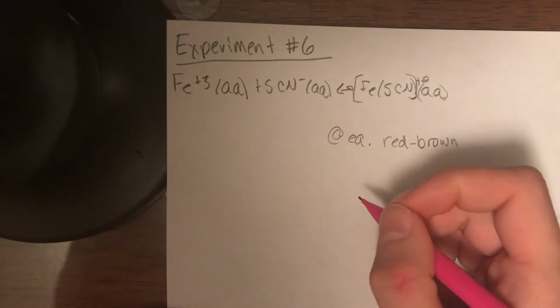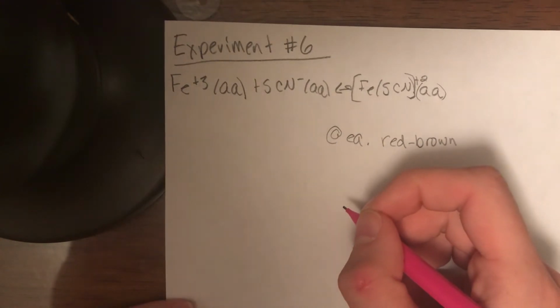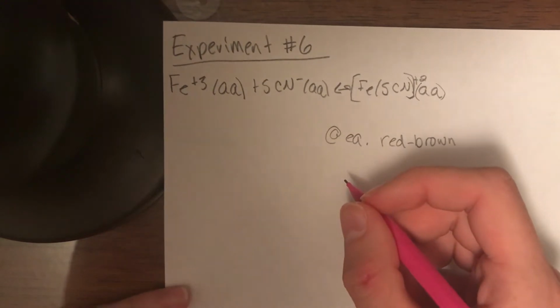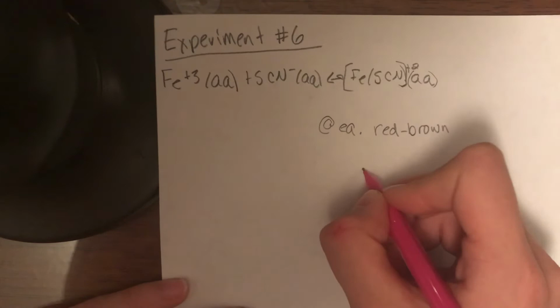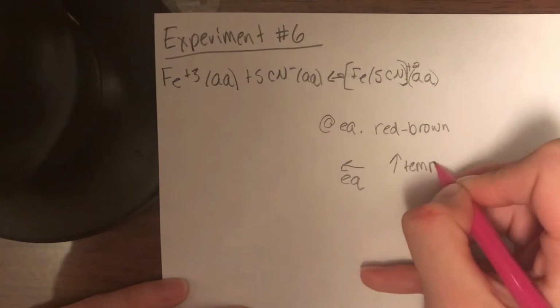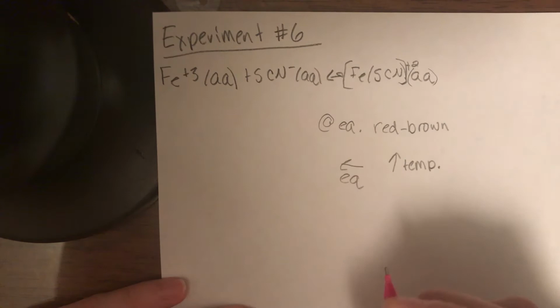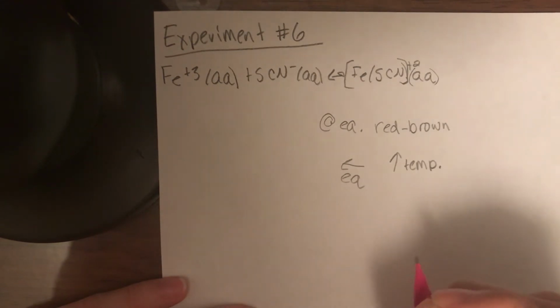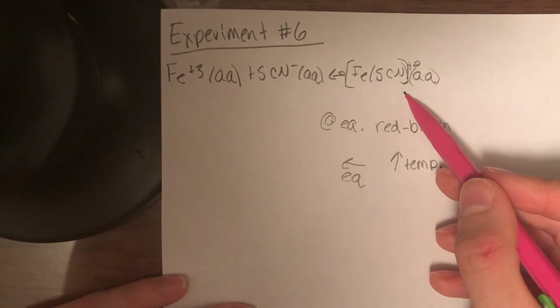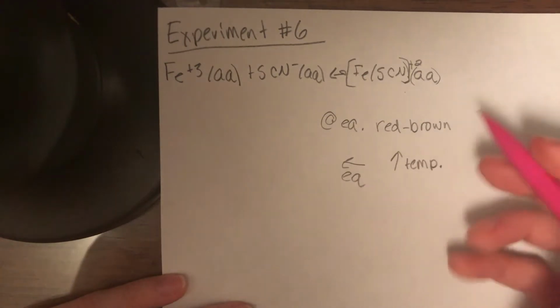The first stress applied to a sample of the solution was placing it in a hot water bath. Because heat was being added to the product side, based on Le Chatelier's principle, this is an exothermic reaction, which would cause a shift to the left in equilibrium. Our experiment proved this because the solution turned from a dark brown color to a light red, meaning that the product side of the reaction has less than it started with, which explains a lighter color to maintain equilibrium and a shift to the left, making it an exothermic reaction.